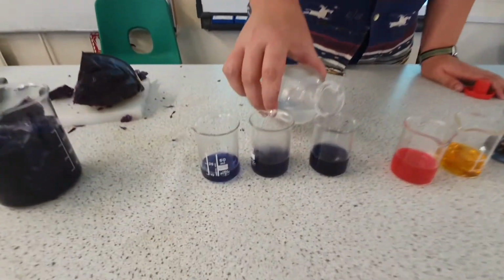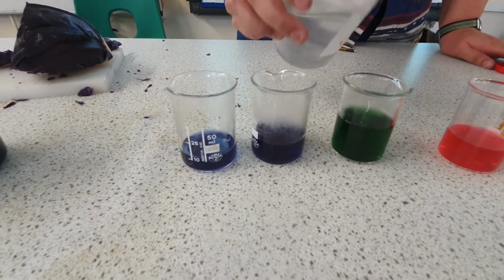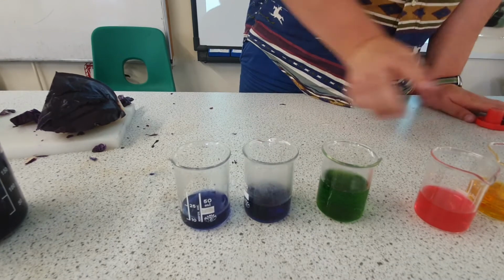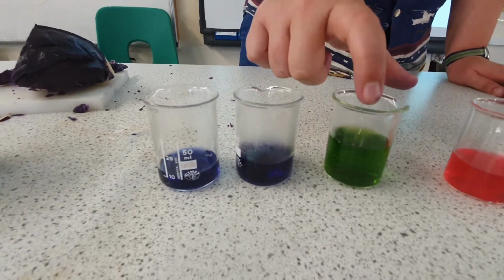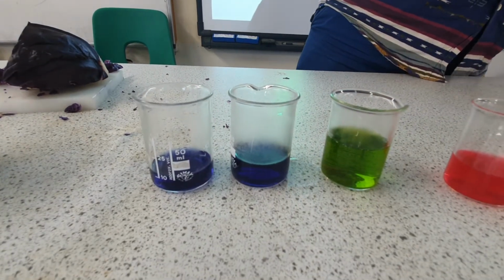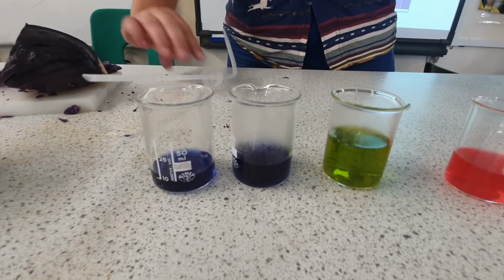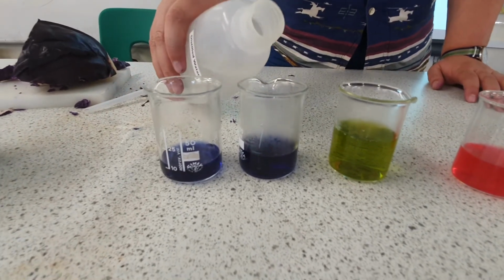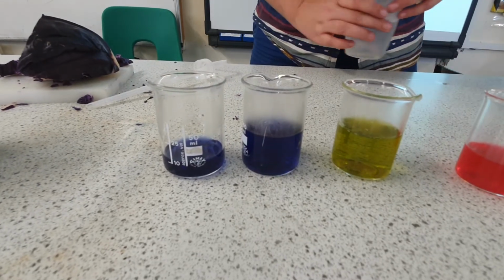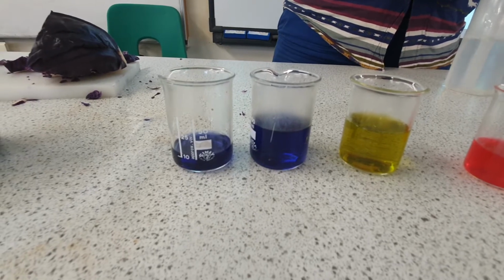So with an alkali, you can see it's gone green. Okay, so on this scale, the alkali has made the indicator turn green. We'll try again with our water, which will show us what neutral, neither acidic nor alkali, looks like. And it stayed the same colour. That's usually what we expect with an indicator. It just stays the same colour in neutral.